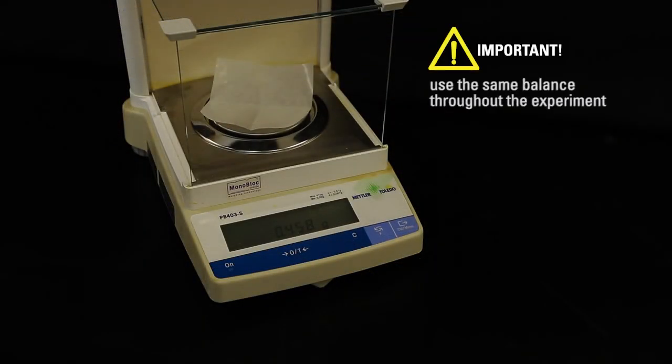Use the same balance throughout the experiment to minimize weighing errors due to small variations in balances.